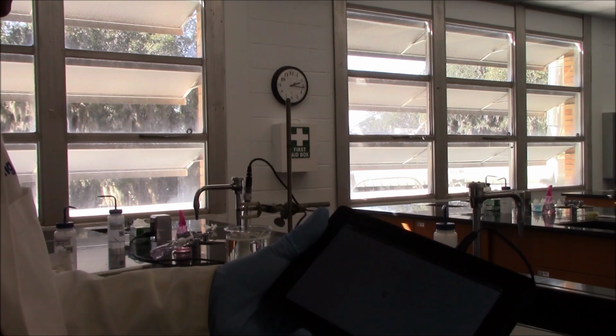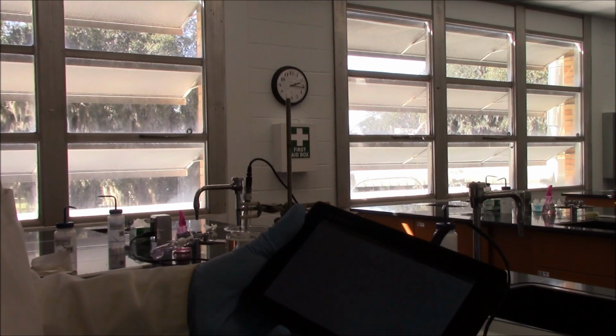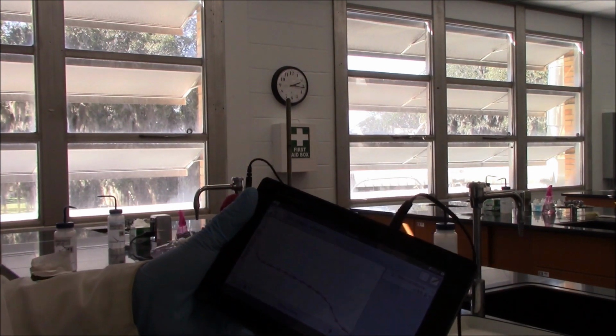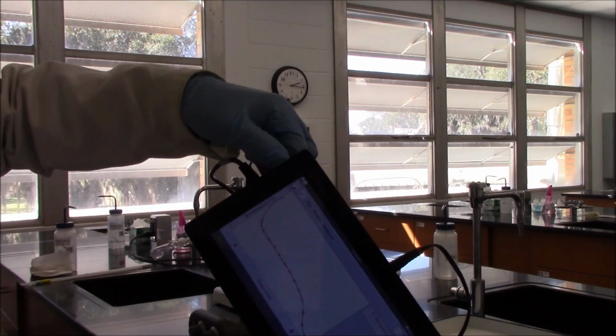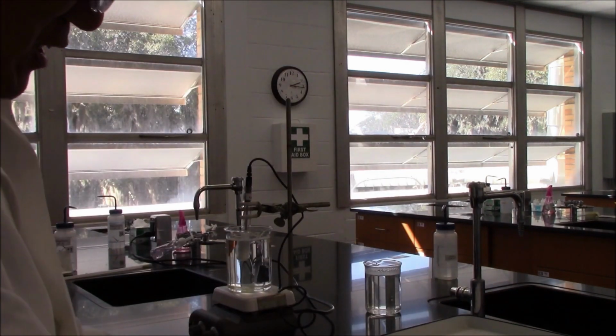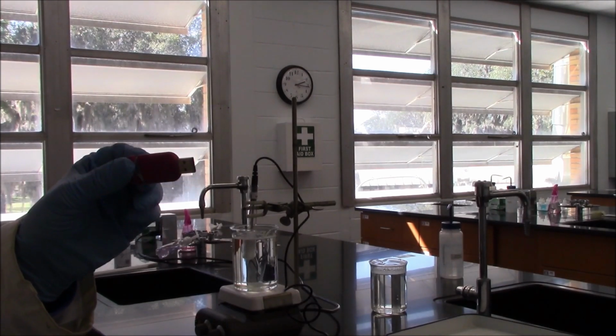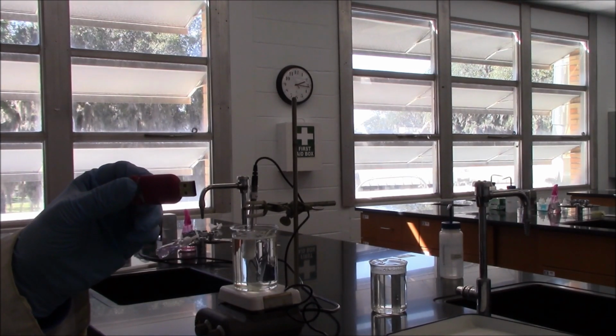Click OK. To make sure the file is already saved, you unplug the USB drive, then insert it into a computer, and see if you can find the file or not. If you don't, you come back and export again.